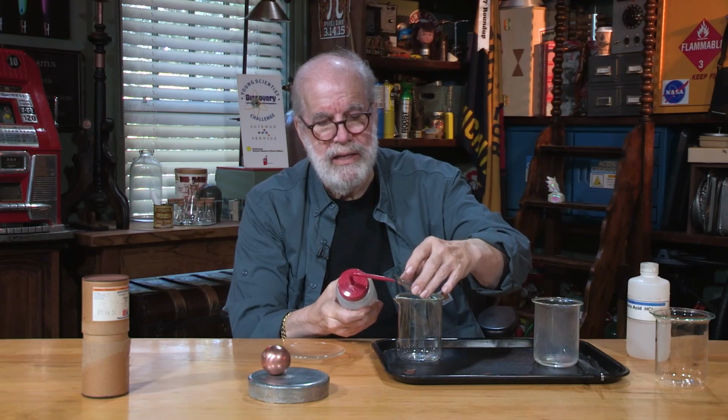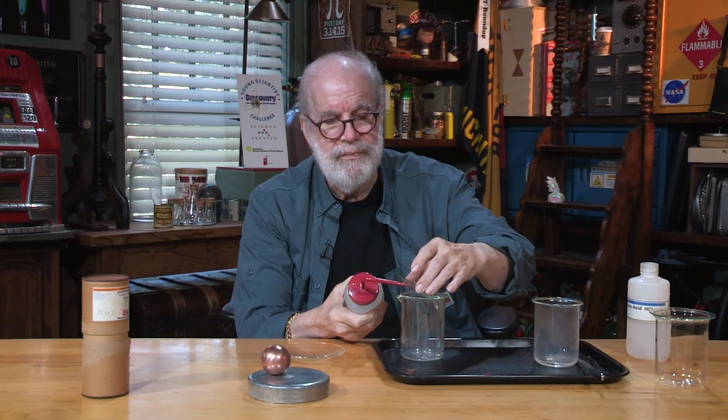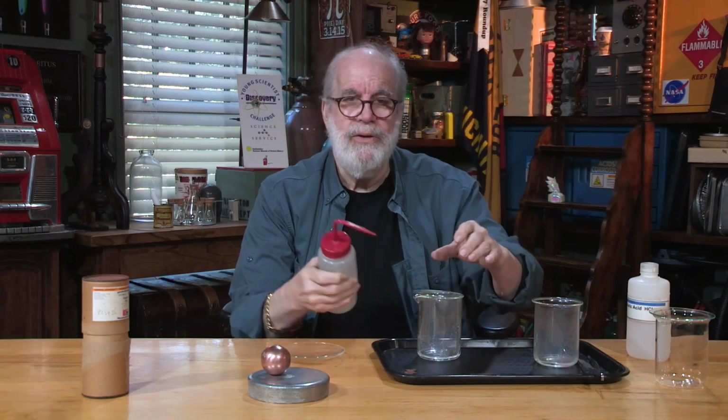Then I can just take the wash bottle, rinse that. There you go. Get that dang thing off of there. Use some distilled water and I can get it down so it's not so concentrated, then that's not gonna hurt anybody. That had my heart pounding there for a second. So now you can all rest easier. The mighty wizard and his squirt bottle saved the day.